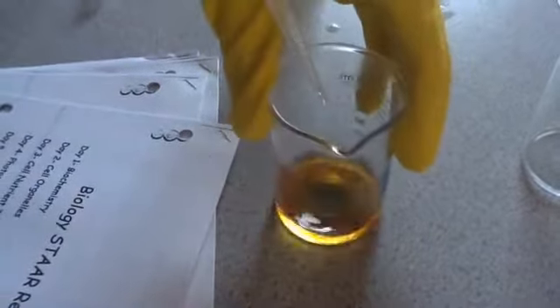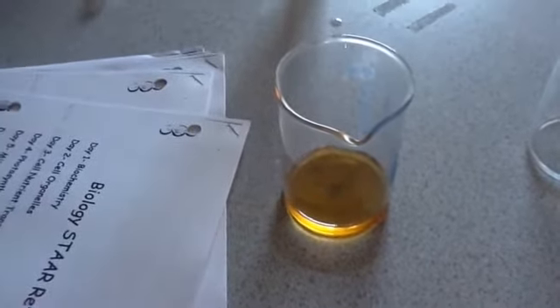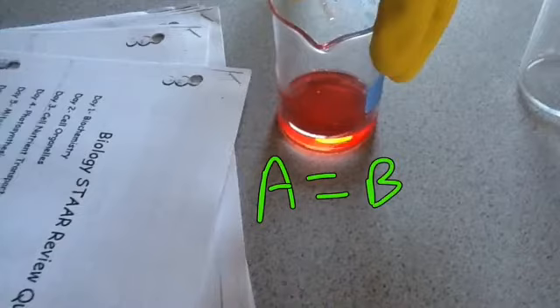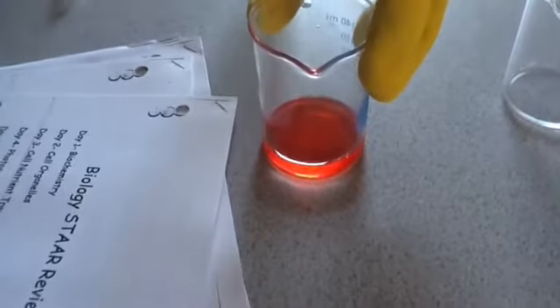So swirling it around. And I got to a yellow. When it's completely yellowish orange, that means I have the exact same amount of acid to it. Pretty close to it. Now you see it's like an orange red, right? If I get all the way to red, that means I added too much acid. So right here, your acid equals your base approximately in terms of the amount of moles of acid and moles of base. This one actually determines pHs in between acids and bases.